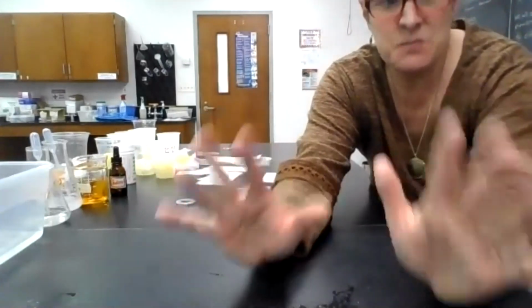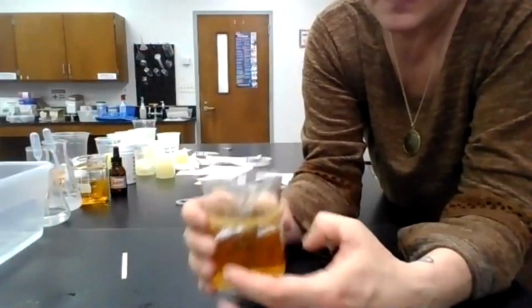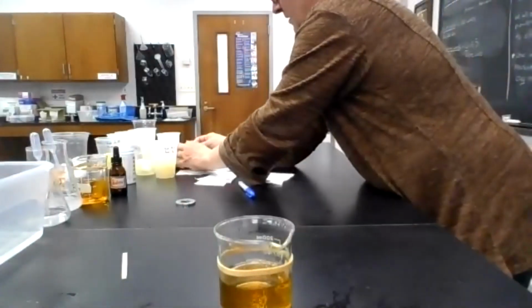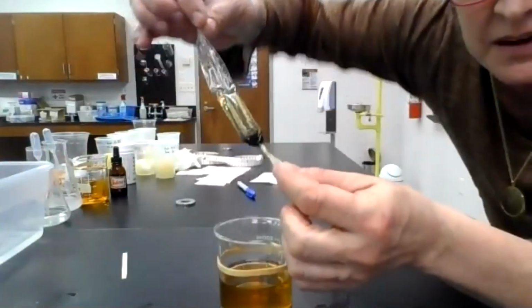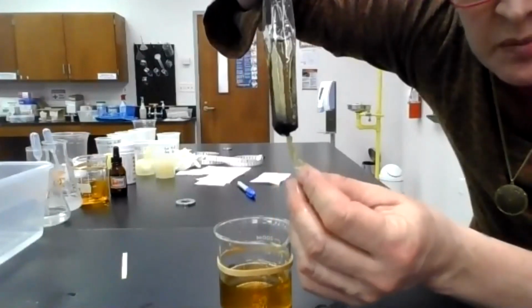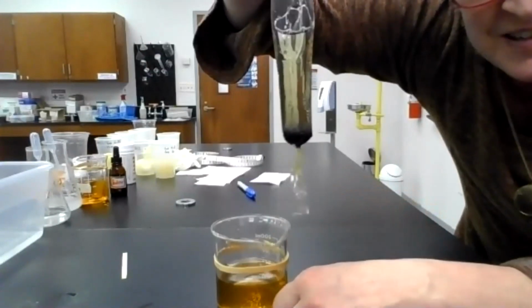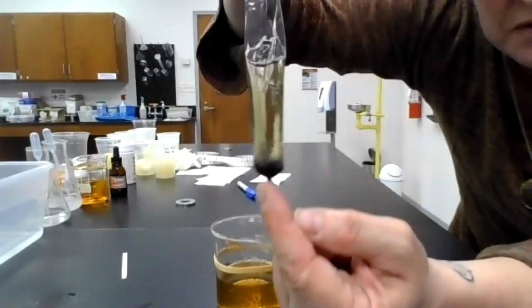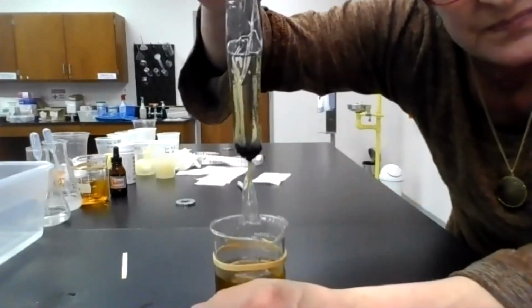Time warp. It's been 30 minutes. Here's the experiment. Okay. It's been 30 minutes. Here is our bag. Now, let's just get the water off of it really quickly here. Look at this bag very carefully. Does it look like there's a bunch of blue or blackish flecks at the bottom of that bag? There sure is. Okay. Now, what has happened here? What turned what was previously a milky white solution of glucose and starch blue?